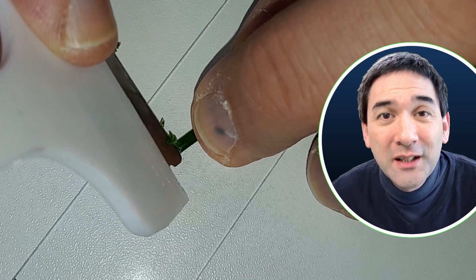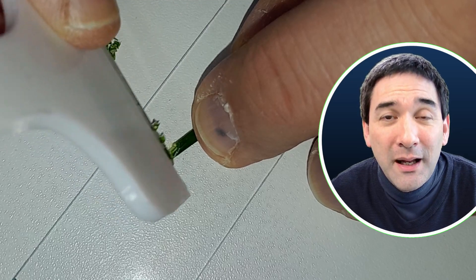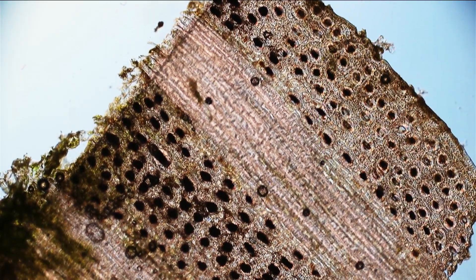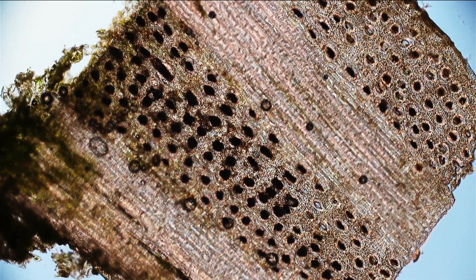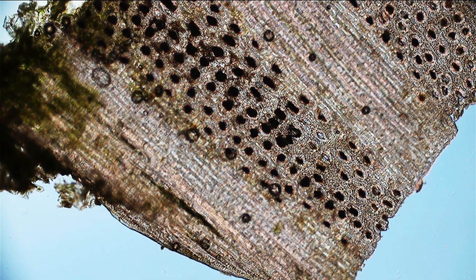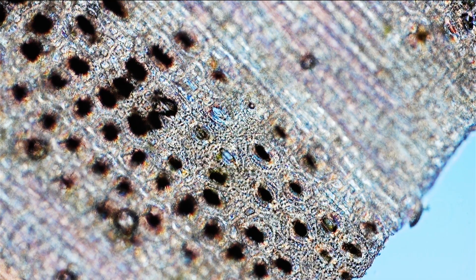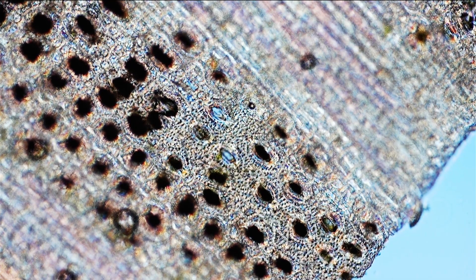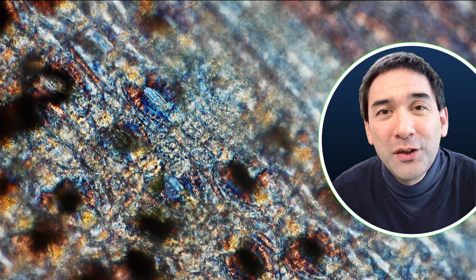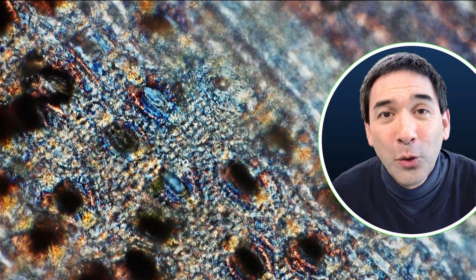I also tried a different preparation technique — scratching away the top layers of the leaf to leave just the lower epidermis. Those dark dots you see are the interesting parts: these are so-called stomates, little openings in the bottom side of the leaf, and this is how the plant breathes. Those little openings allow gases to go in and out. Carbon dioxide gas is able to enter the leaf from the air, and by photosynthesis the leaf also produces oxygen gas, which exits through those openings on the bottom side.